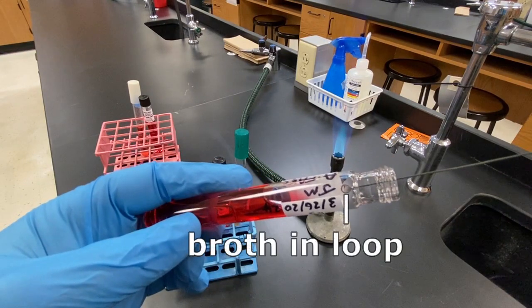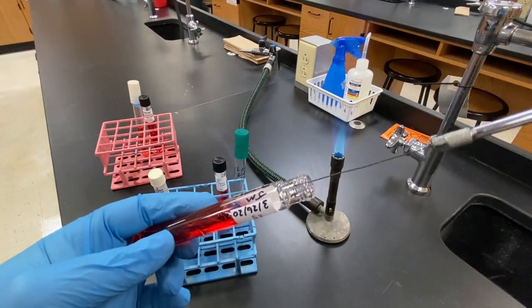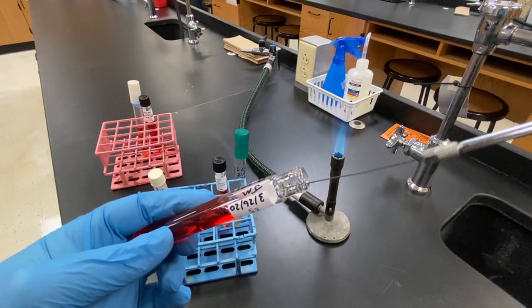Thinking back to smear preparation, you should remember that the loop is capable of holding a quantity of liquid. This is the most significant contamination issue when working with broths. If the loop is withdrawn with broth held in it, that broth will contain a great number of microbes and can easily fall off. The solution is to agitate the loop while still inside the tube so that the broth is knocked out. Do not be too vigorous, or you could end up splashing the broth out of the tube.